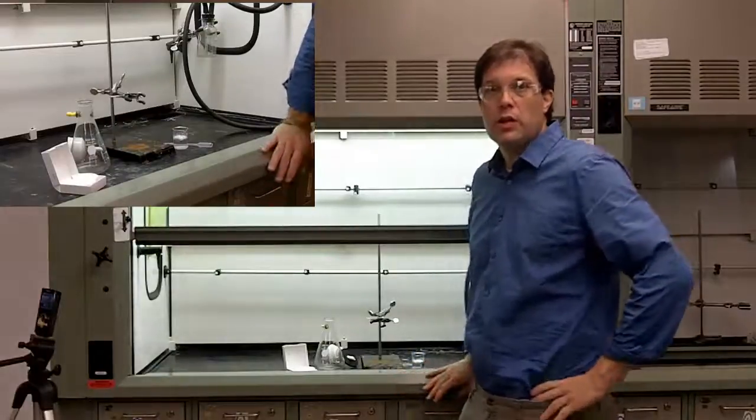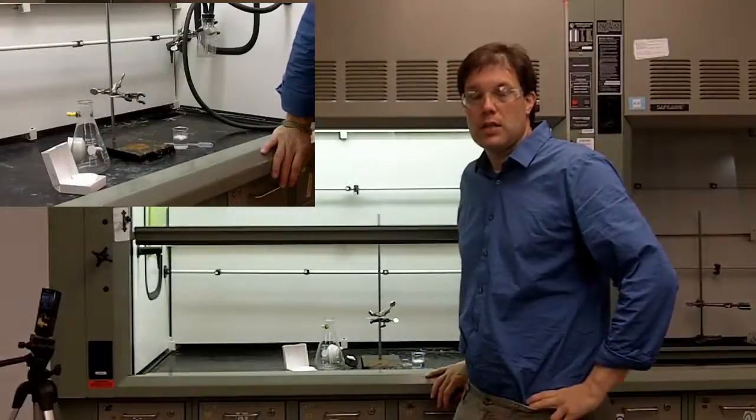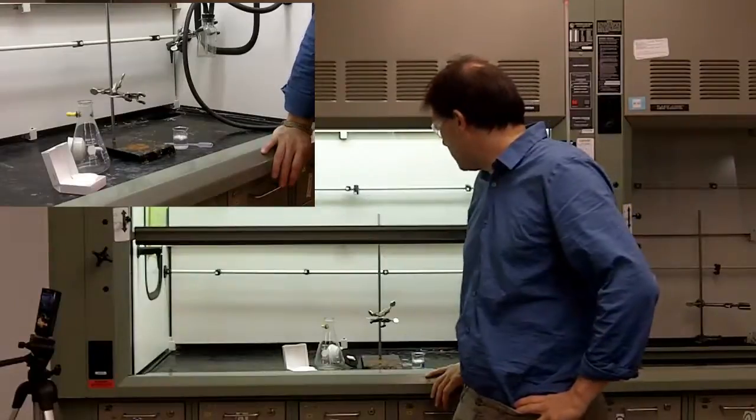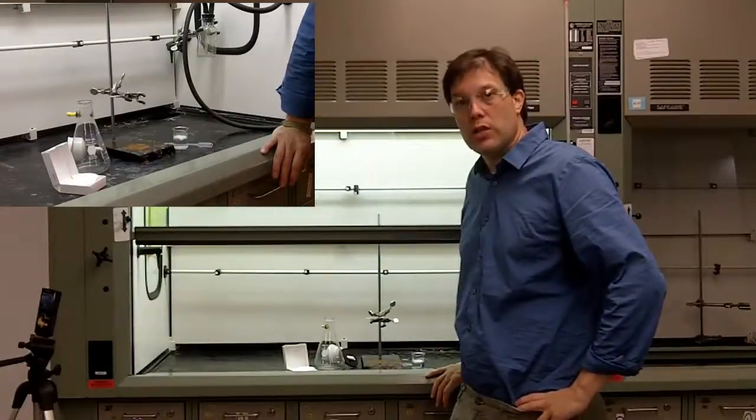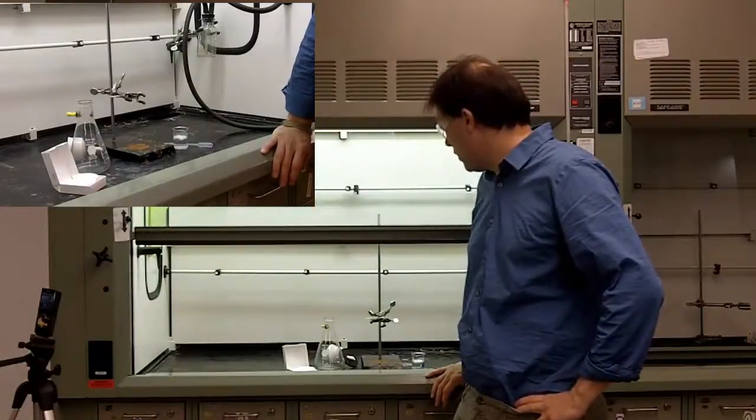This video is very quickly going to go over how to set up a suction filtration. So to set up suction filtration, what you need is a few different things.